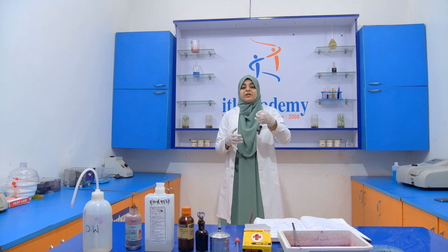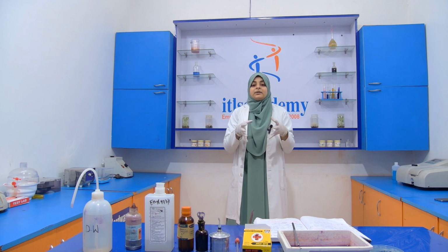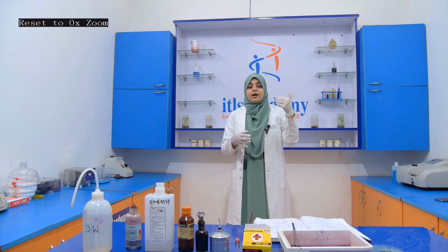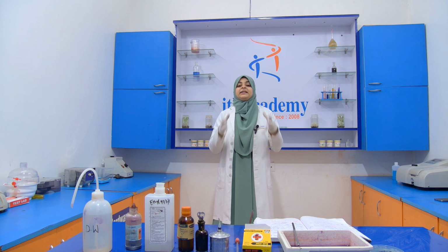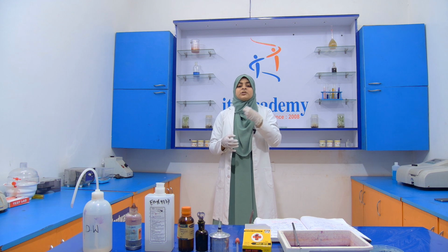Gram positive bacteria hold it, making a bond with the crystal violet, so when we wash it, it will not wash off with distilled water and also does not decolorize with ethanol. But gram negative bacteria have a very thin peptidoglycan layer, and when we use a decolorizer, they decolorize and do not retain any crystal violet color.